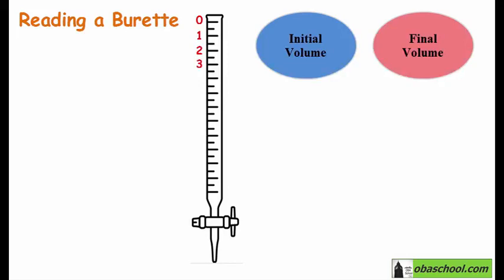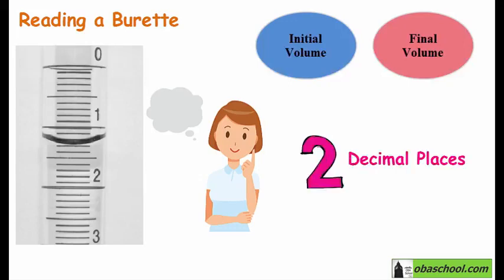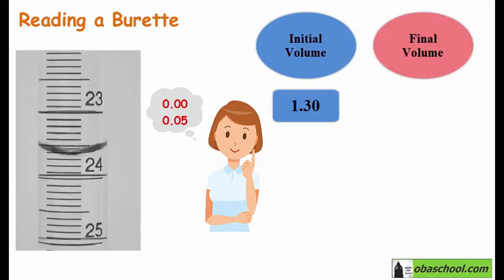Now we will take the initial reading. The reading should be taken to 2 decimal places, where the second one is 0 or 5. So this is 1, 1.1, 1.2, and 1.3. So we should report this reading as 1.30. Then we will run the titration and we will record the final reading.